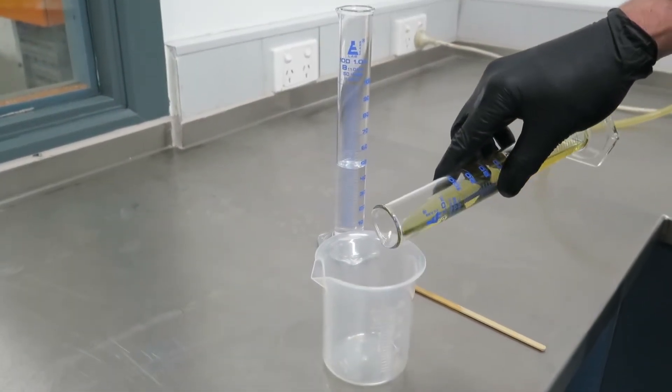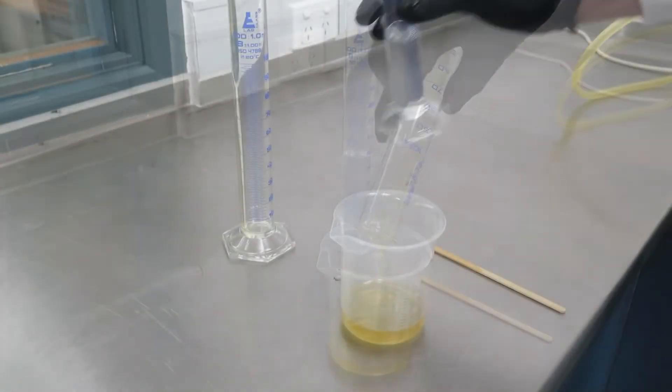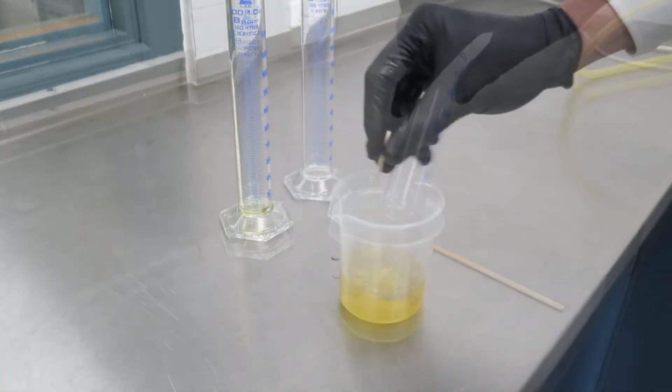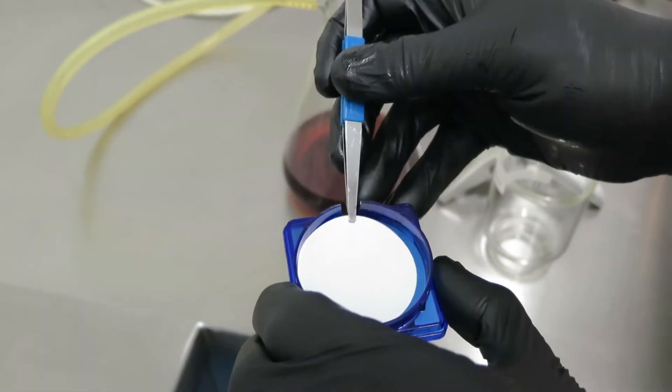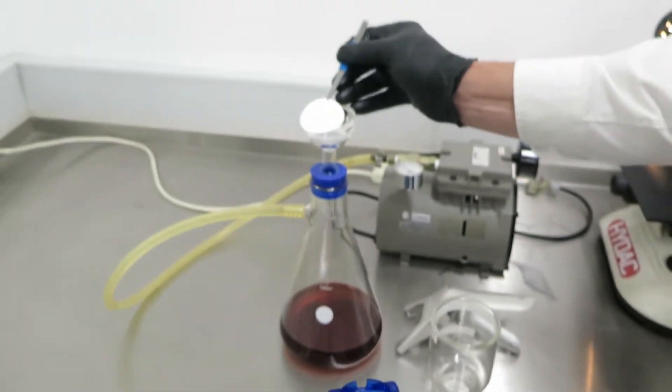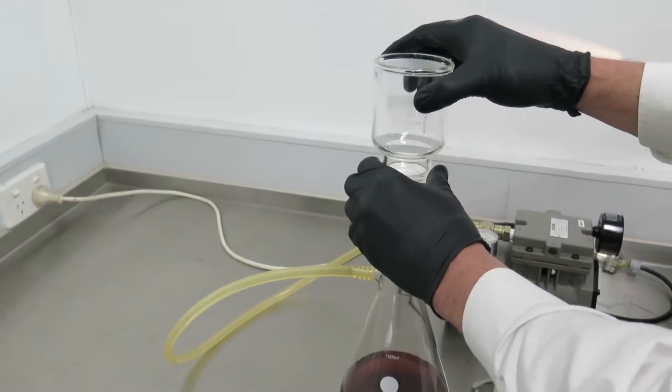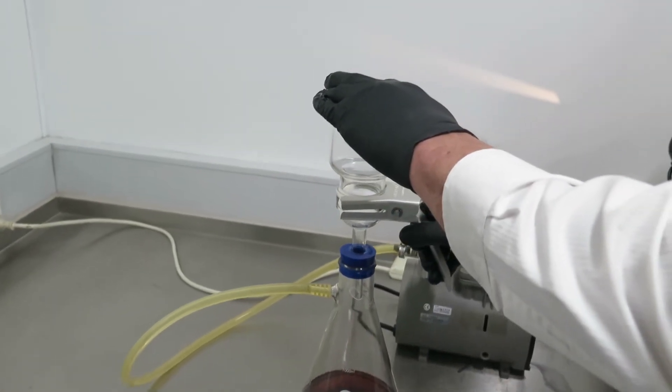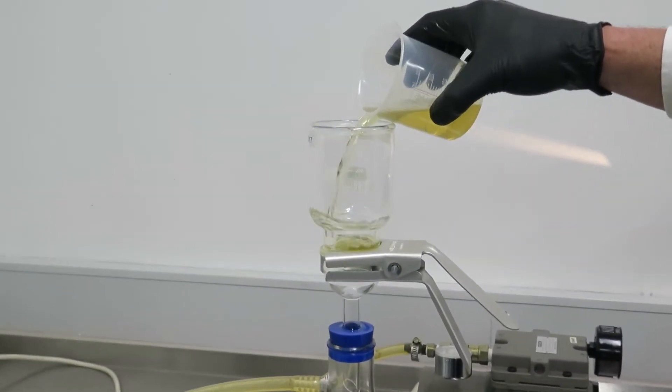Add 50 milliliters of new oil into the beaker and dilute it with 50 milliliters of new solvent. Add a membrane on the top of the glass flask using tweezers. Place the funnel above and secure it with a clamp. Pour the mixture into the funnel.